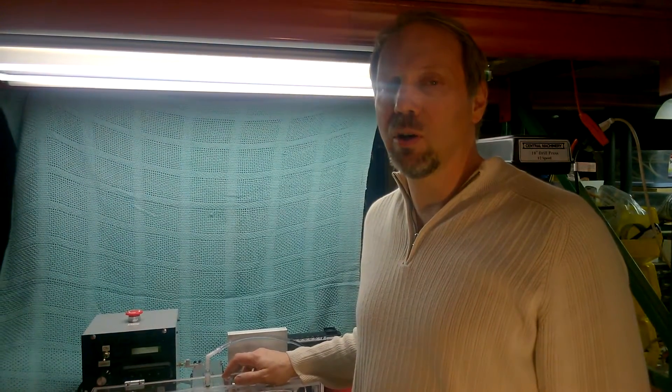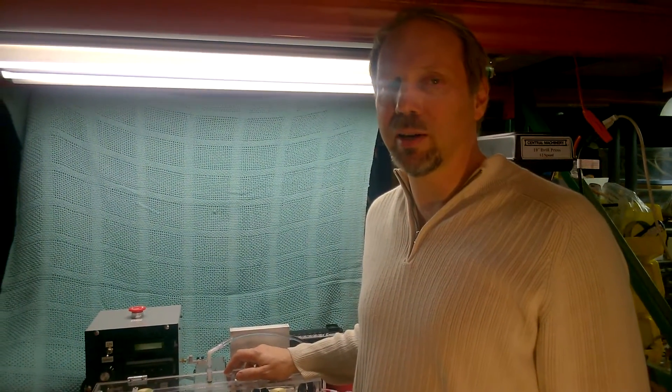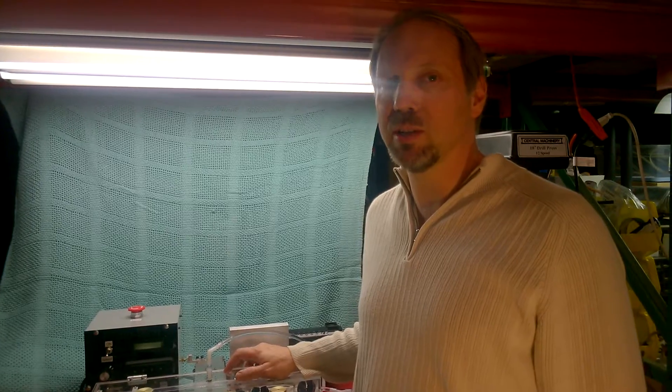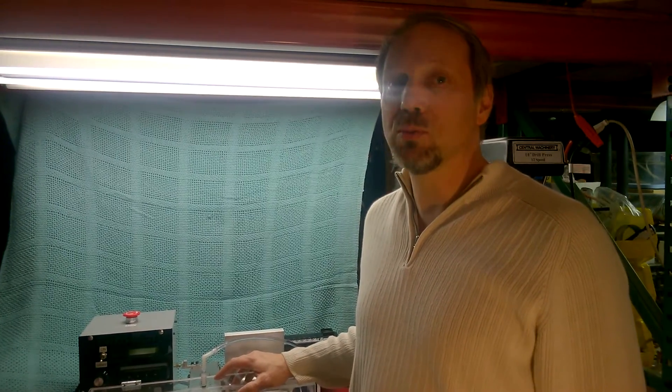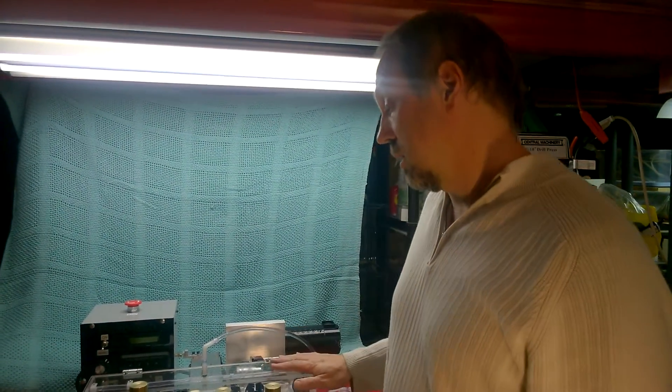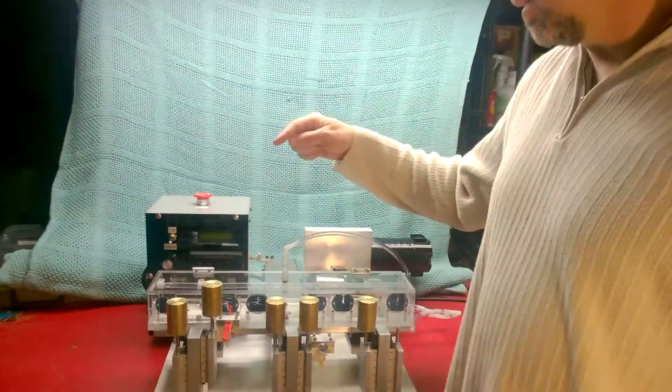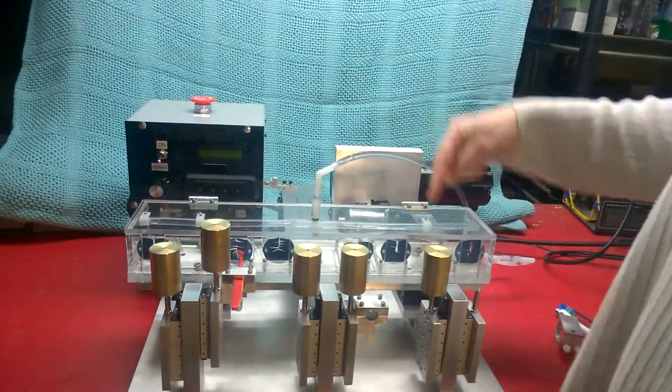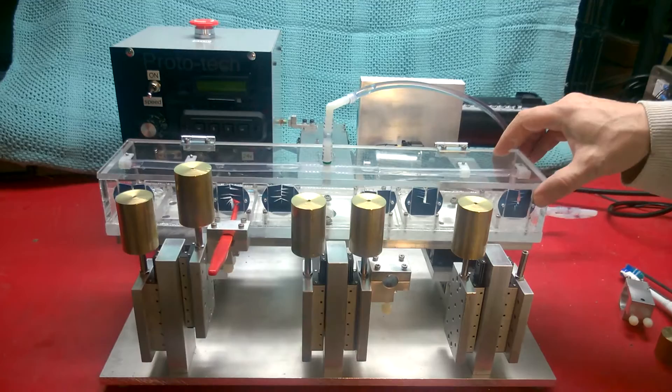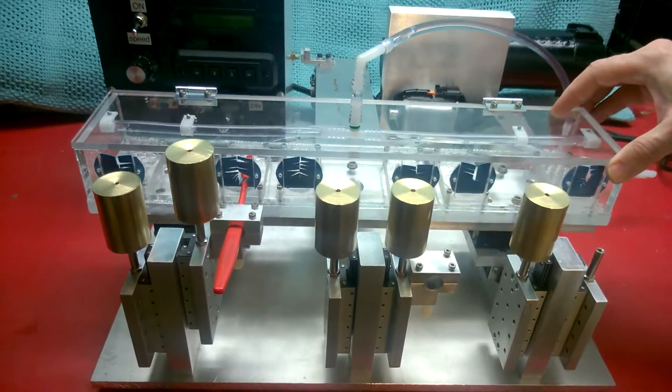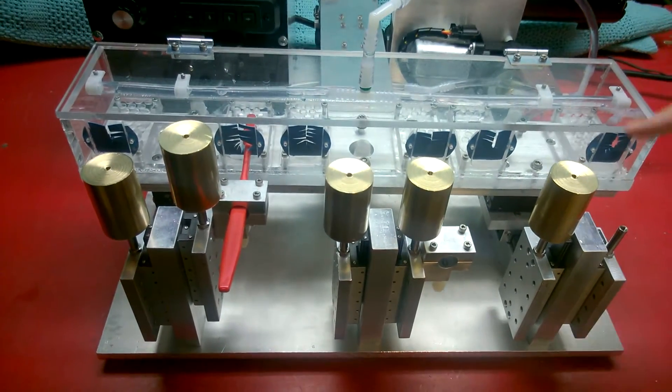Hi, I'm John Condon from Prototech and I'm going to show you the operation of the toothbrush wear simulator. This machine has six stations to simulate the wear of toothbrushes six at a time.